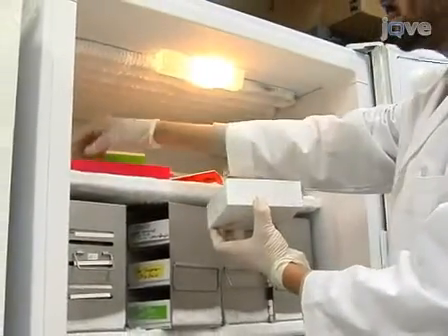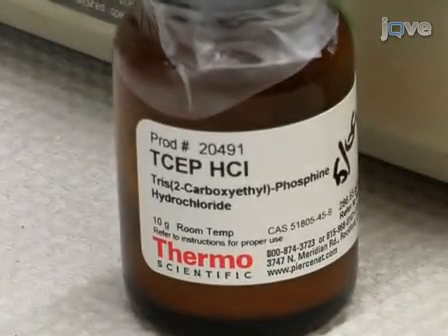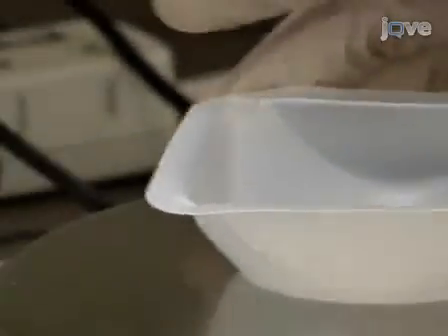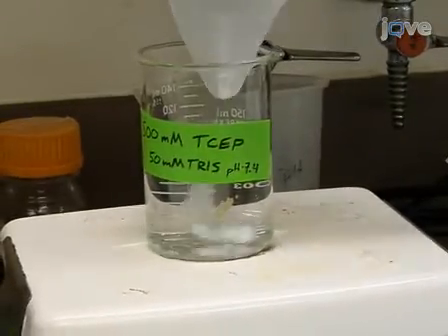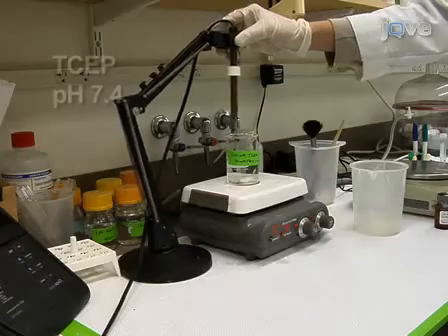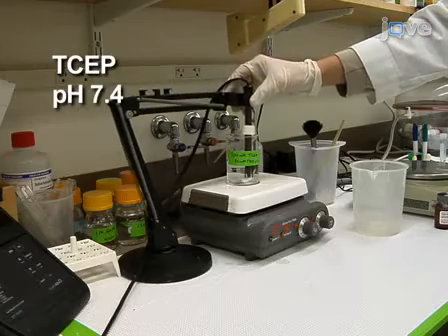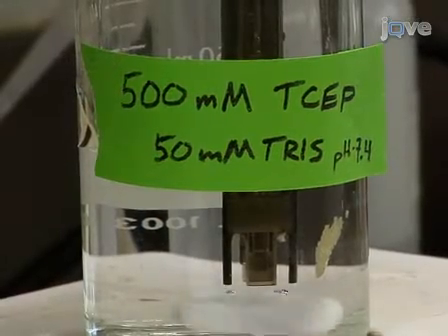Aliquots can undergo several freeze-thaw cycles. Following this, prepare tris-2-carboxyethyl phosphine hydrochloride (TCEP) stock solution at a concentration of 500 millimolar dissolved in 50 millimolar tris, and adjust pH to 7.4. Since TCEP is highly acidic, the pH will need to be adjusted. Cover TCEP in foil before storing at minus 20 degrees Celsius.